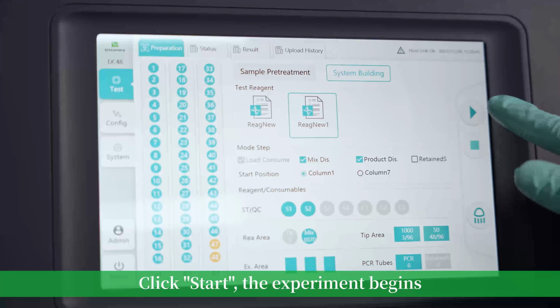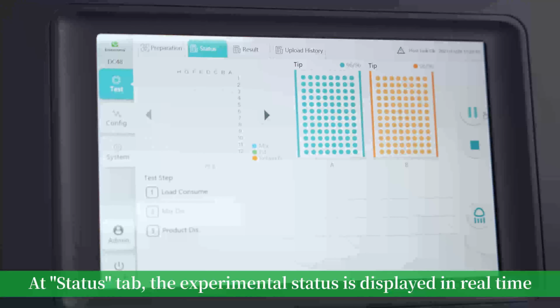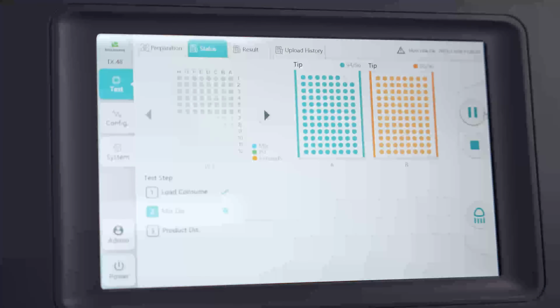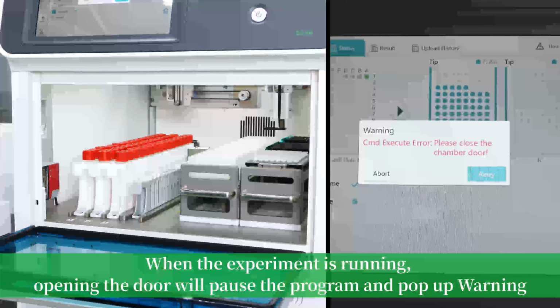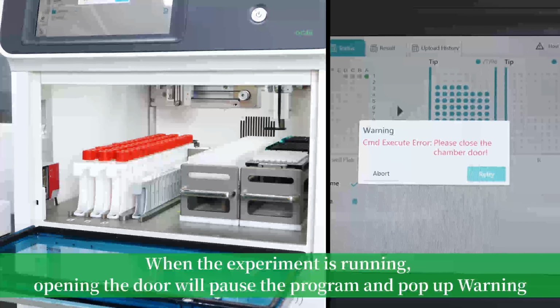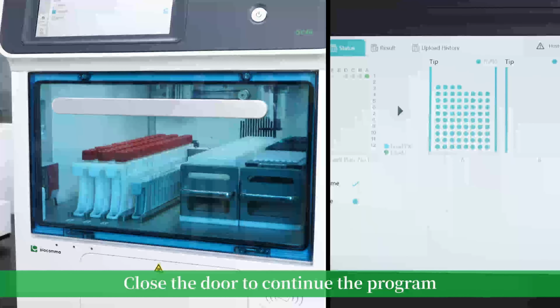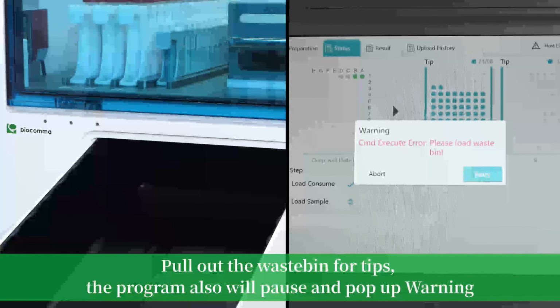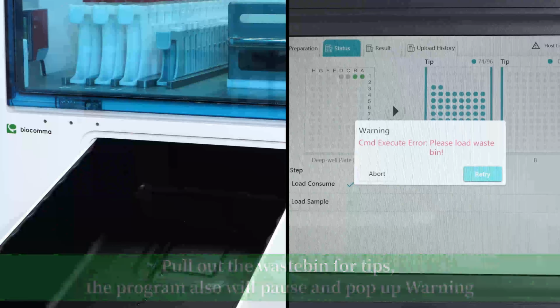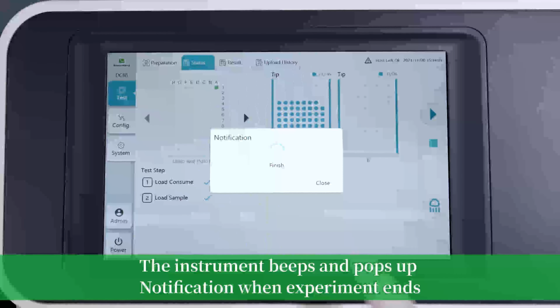Click Start. The experiment begins. At Status tab, the experimental status is displayed in real time. When the experiment is running, opening the door will pause the program and pop up warning. Close the door to continue the program. Pull out the waste bin of tips. The program also will pause and pop up warning. The instrument beeps and pops up notification when experiment ends.